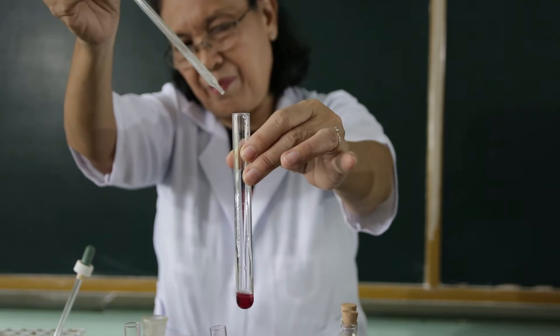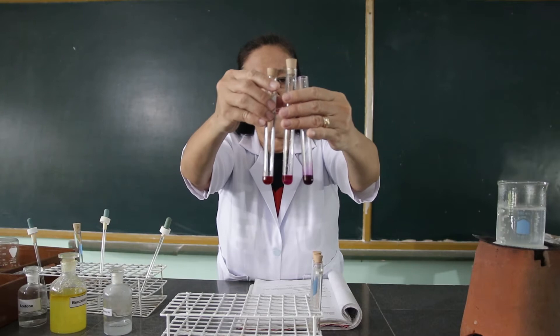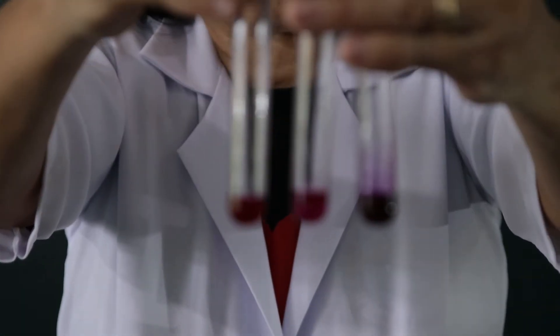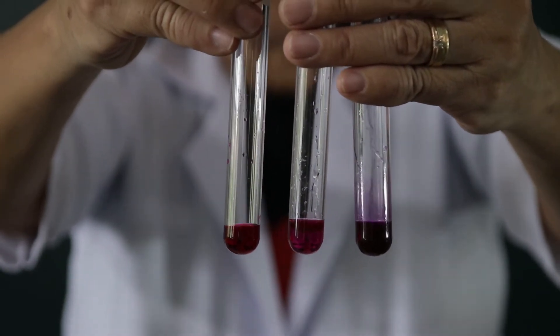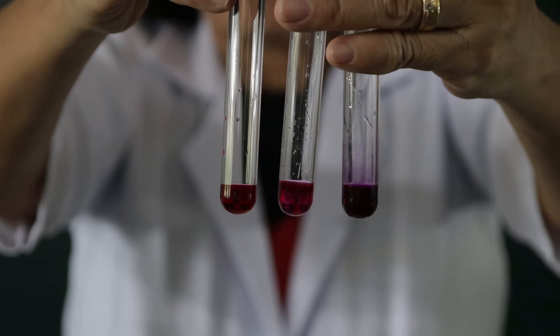I want you to compare what happens. This is the formaldehyde. This is the benzaldehyde. And this is the acetone. I want you to observe what happens — in which test tube does the Schiff's reagent react? Compare their colors.